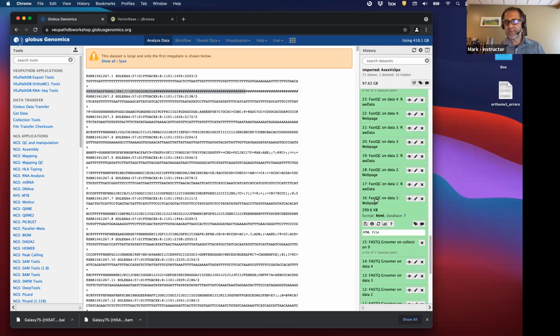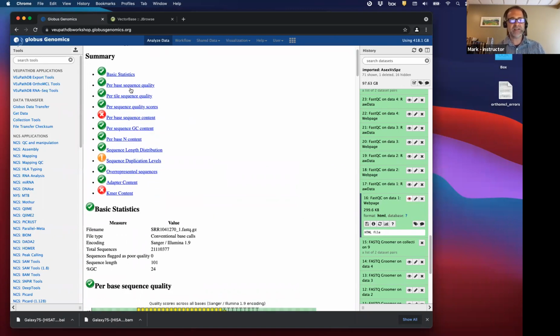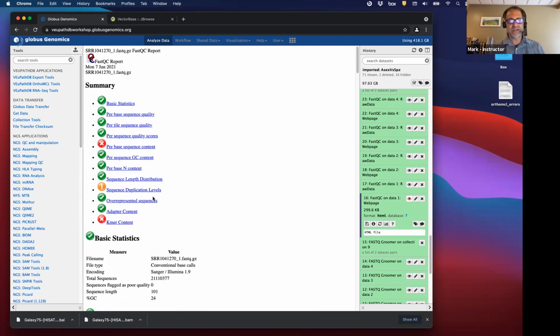So you can see there's raw data and there's a web page. I'm going to click on web page and view it. And here are the results for the FastQC report. It has all these categories that it checks to make sure all your reads are as expected.